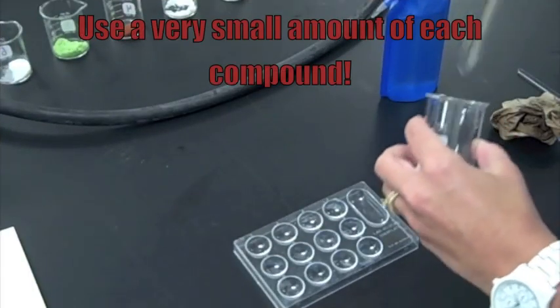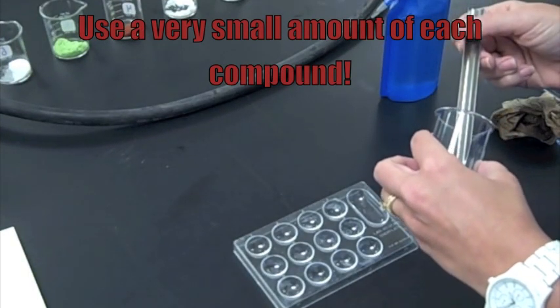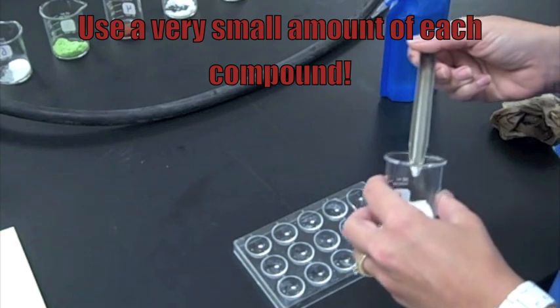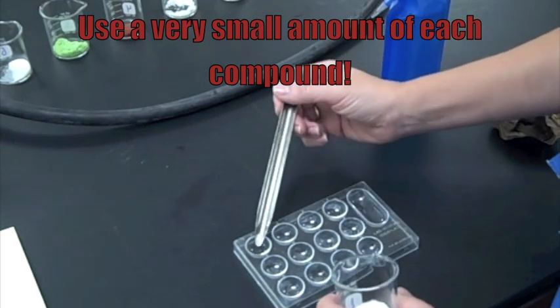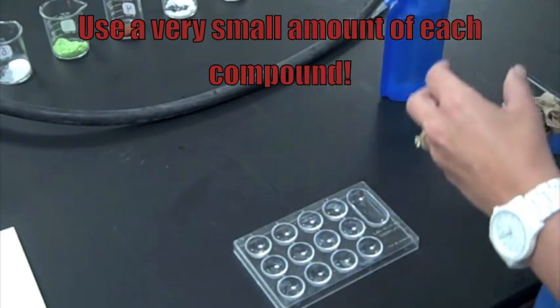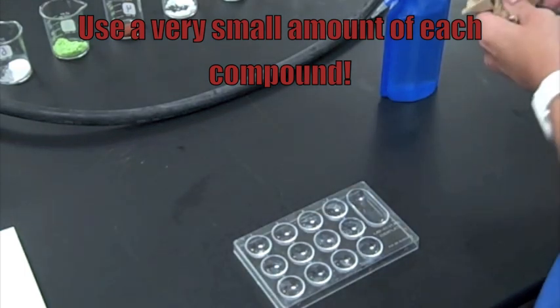Now we're going to test the water solubility of each of these, starting with our sugar. And again, just like the melting test, I'm going to get a very tiny amount of each solid.